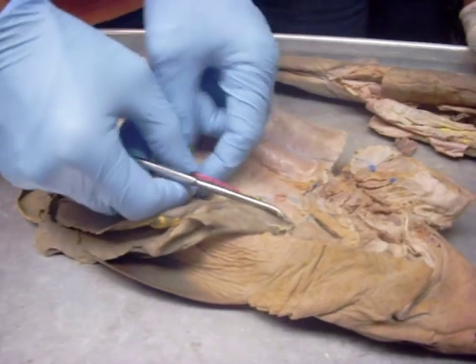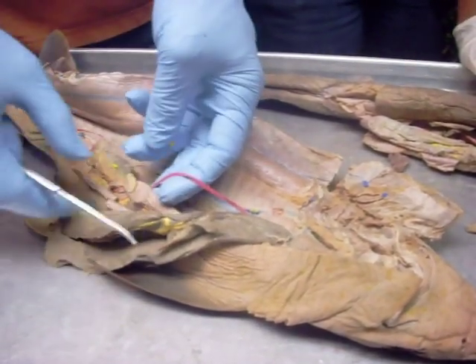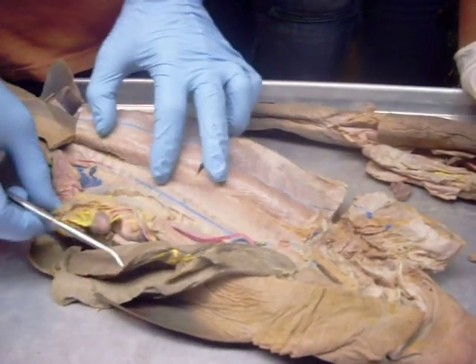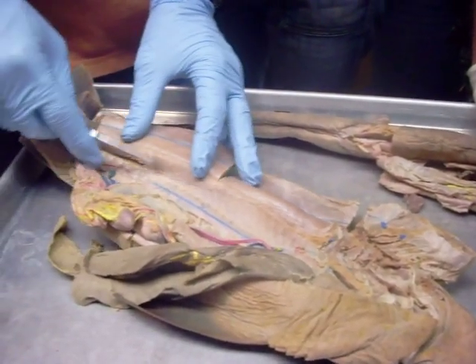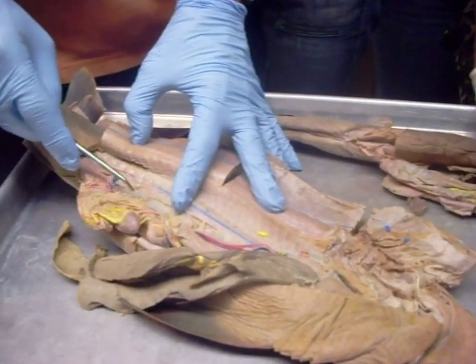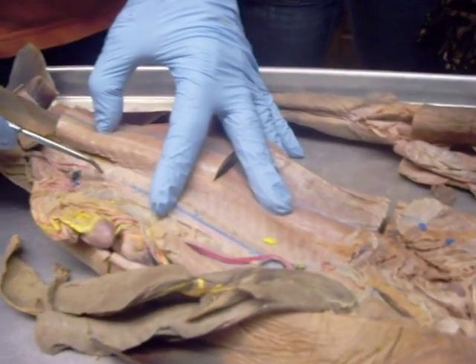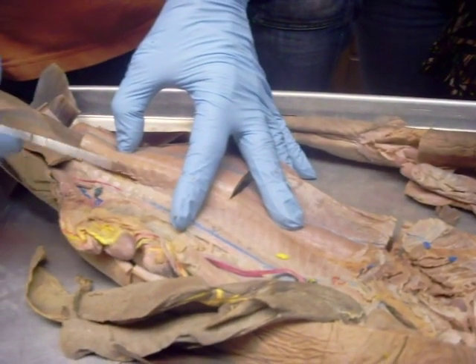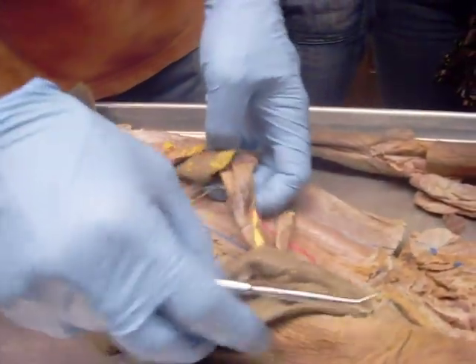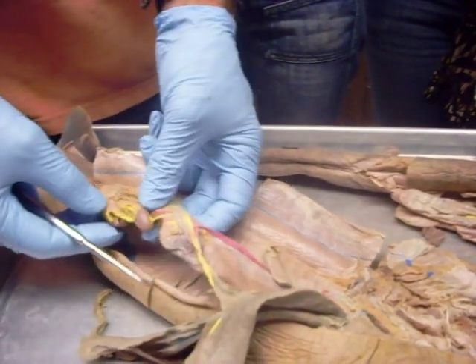Then here, this is the celiac artery, and you can see it going to the small intestine. And then back here I have two arteries that cross — one to the stomach and spleen, that's the gastrosplenic, and one to the intestine, that's the posterior intestinal. As far as blood vessels, that's really all I would have a tendency to do with the arteries.